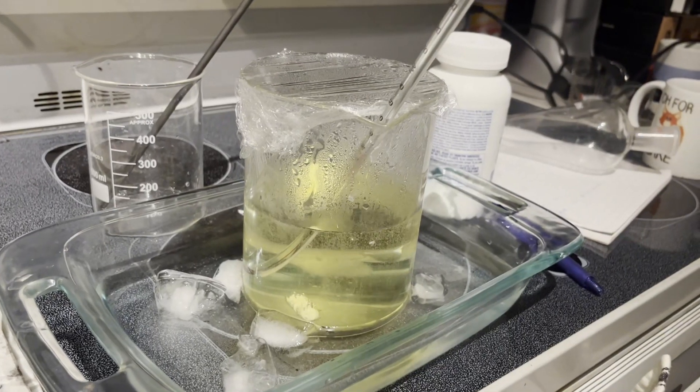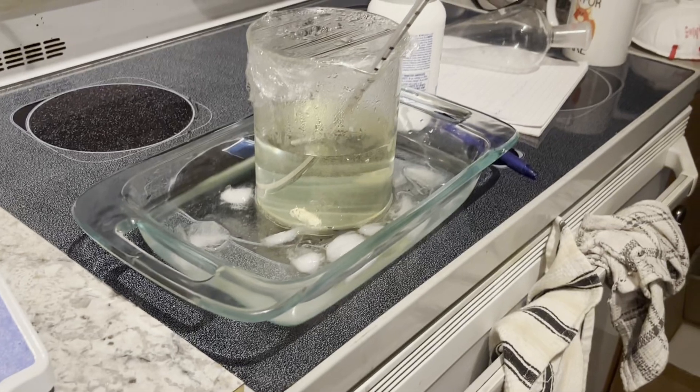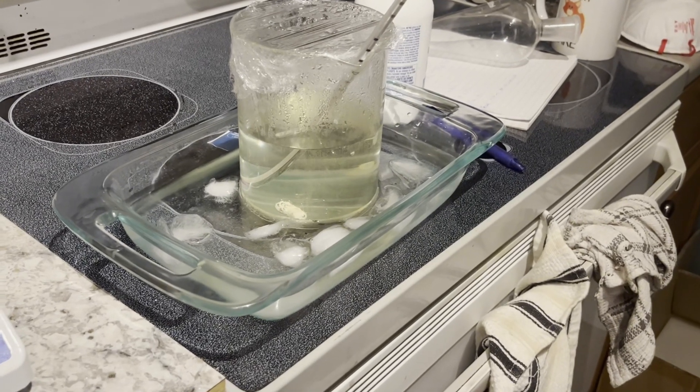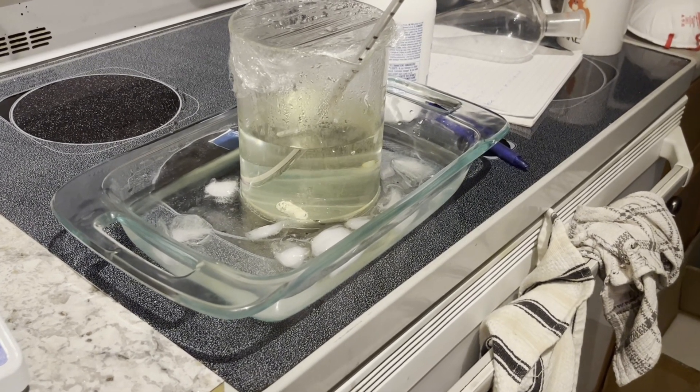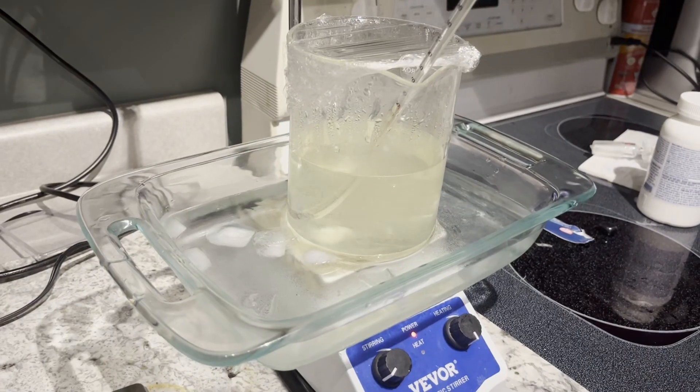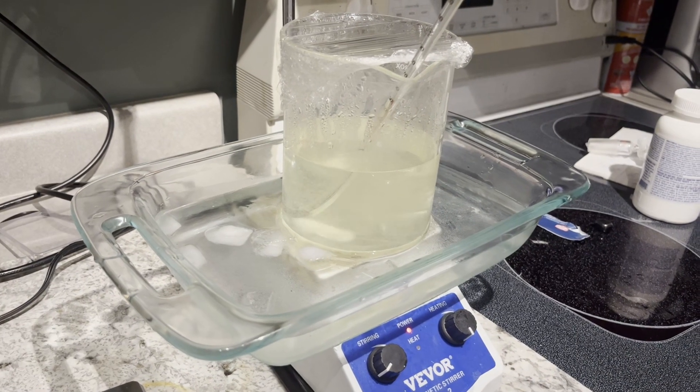As the temperature drops, if you've done it right, it'll get clearer and clearer. If it stays yellow, once again, that's probably because your bleach solution was too concentrated and your hydrazine yield will suffer from that.